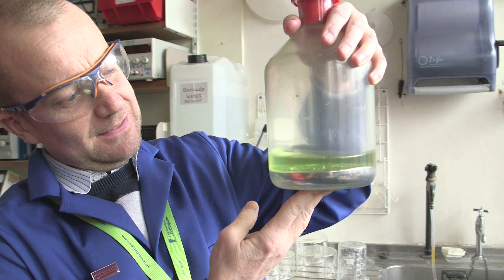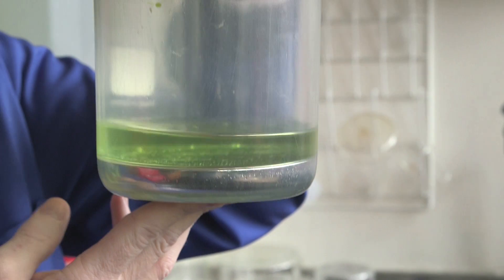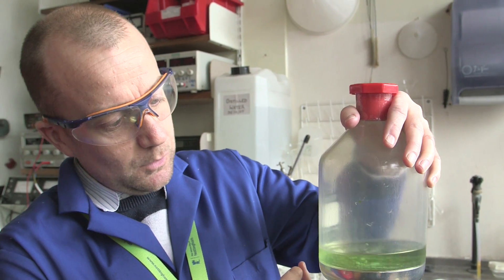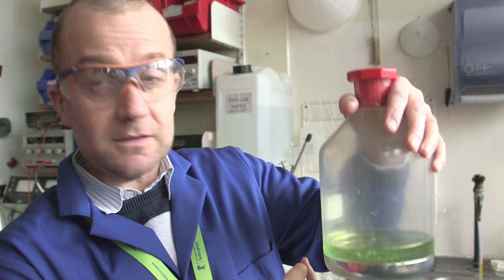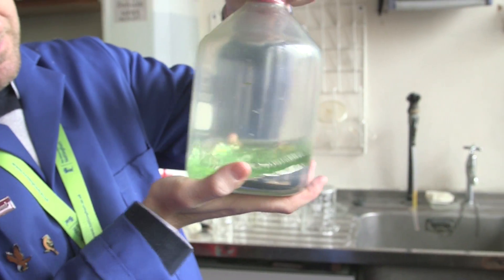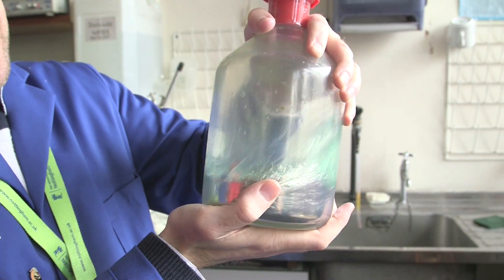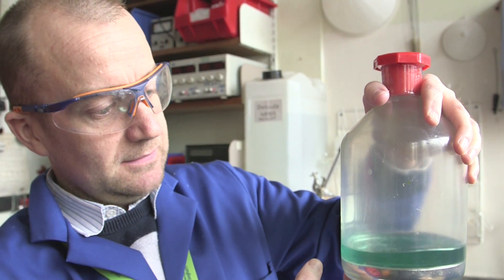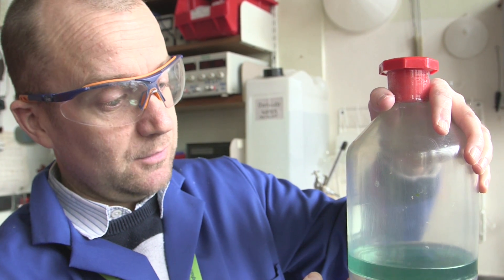The vanadium solution is sitting on top of the mercury-zinc amalgam, and by shaking it up I'm going to convince some electrons in the metal to jump onto the vanadium species, changing the oxidation state of the vanadium. As I do it, hopefully we'll see a colour change. Can you see the yellow? So now, a nice blue colour. The blue colour is vanadium 4 — each vanadium species has gained one electron, changing its oxidation state, or has been reduced.